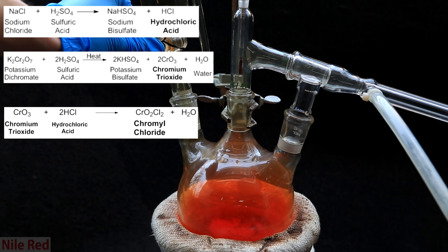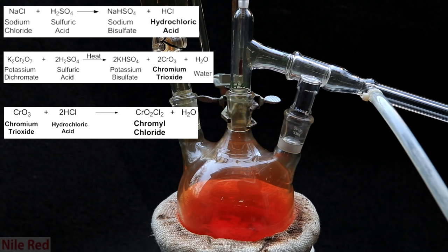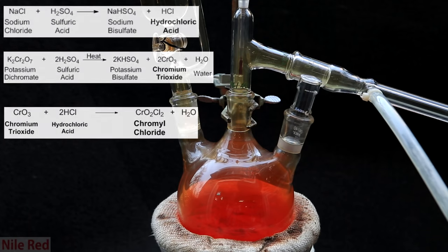However, since we're working with the powder and the mixture isn't perfect, this reaction isn't going to be super efficient and we're going to produce quite a bit of hydrochloric acid gas. To try to compensate a bit for this lack of efficiency, a slight excess of sodium chloride is used.